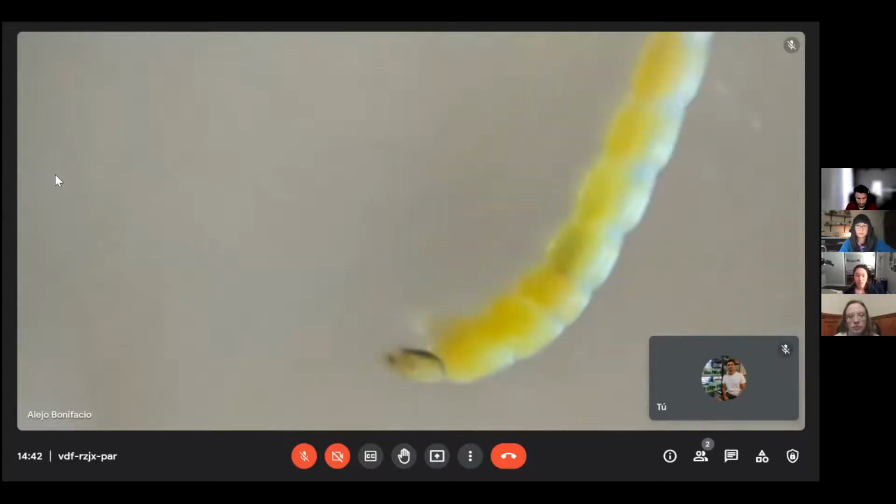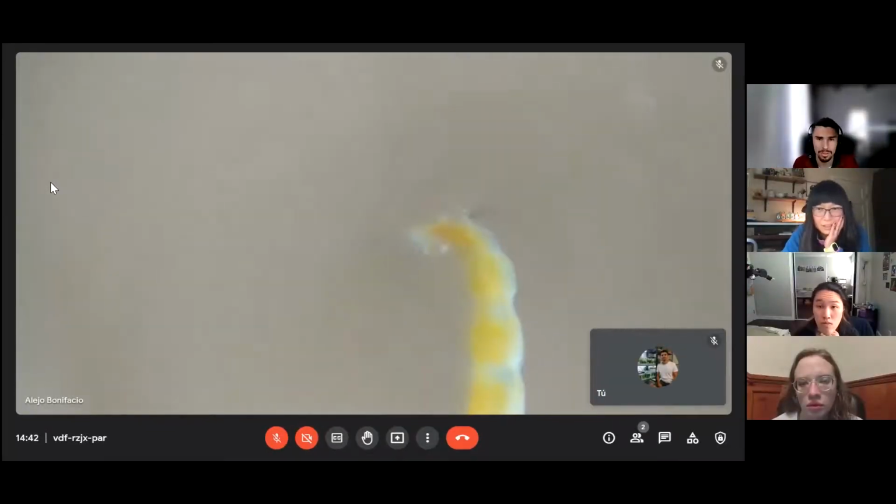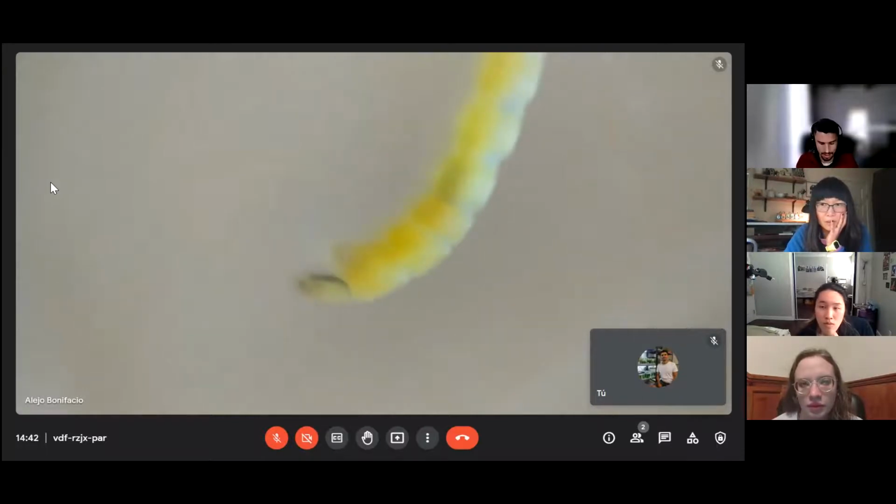But it's easy to recognize them also if they are dead, because they have a C form, and at the end of the tail, in the caudal zone, they have little gills, like a black hair. I don't know if you can see something that comes out. Well, there is not a bloodworm. The bloodworm is a chironomid. Yes, this is a bloodworm.